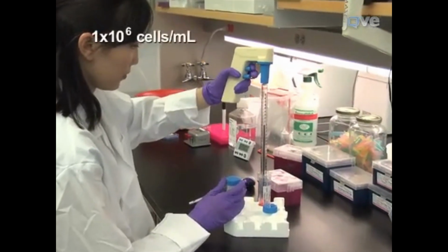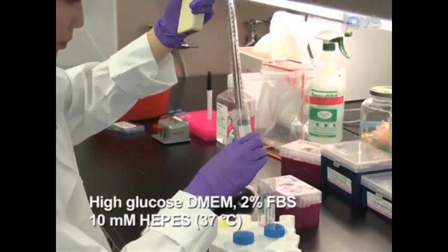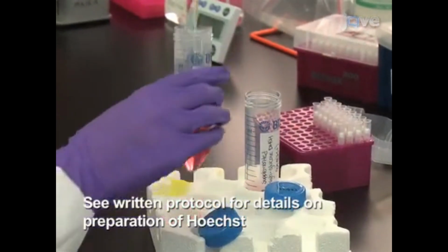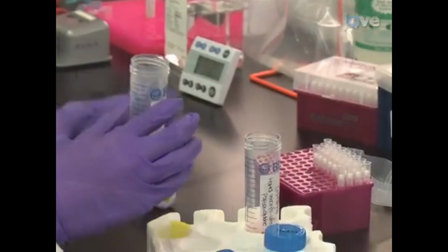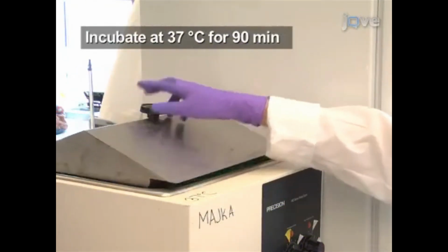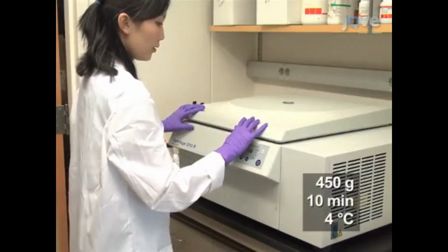To stain the cells, resuspend both the lung and bone marrow cells at 1 × 10 to the 6th cells per milliliter in pre-warmed supplemented high glucose DMEM. To stain the DNA, add Hoechst 33342 dye to a final concentration of 5 micrograms per milliliter. Next, mix the cells by gentle inversion and incubate in a 37 degrees Celsius water bath for exactly 90 minutes. Then centrifuge for 10 minutes at 450 Gs at 4 degrees Celsius.